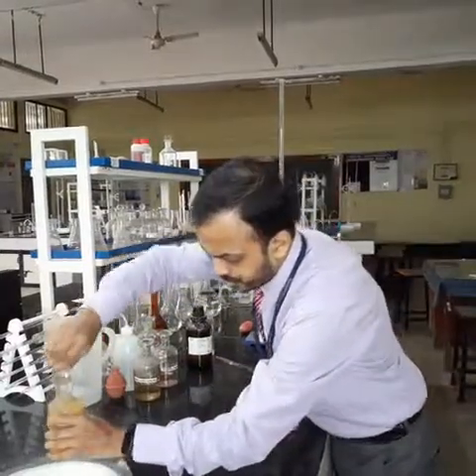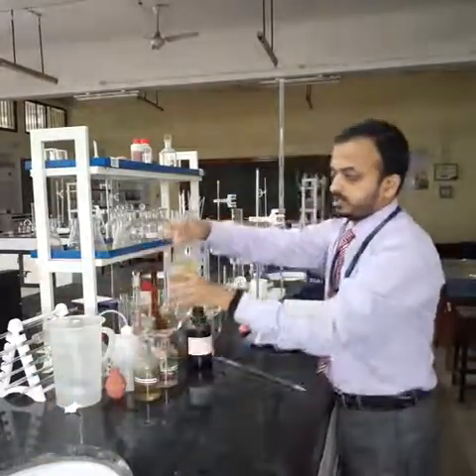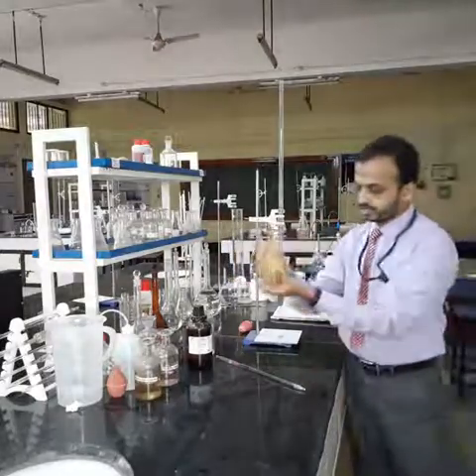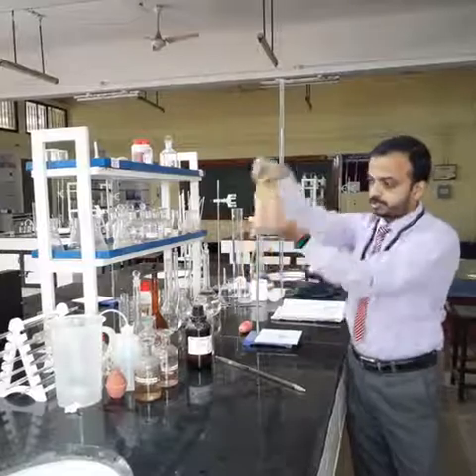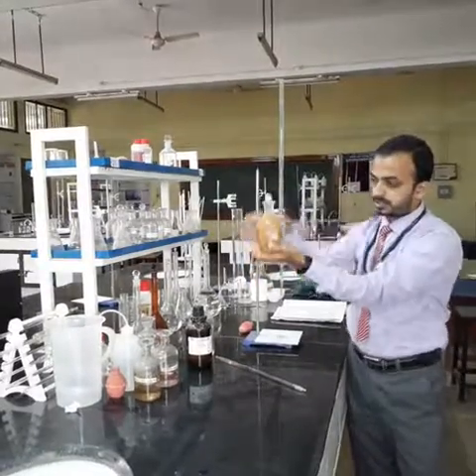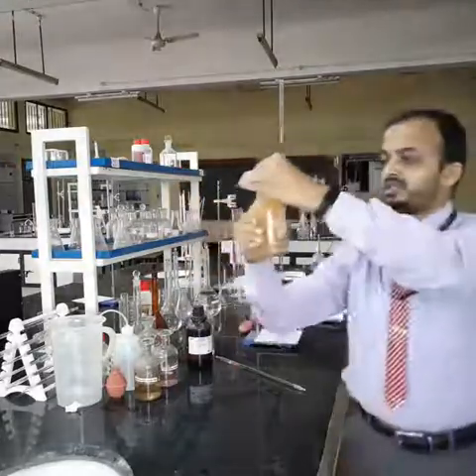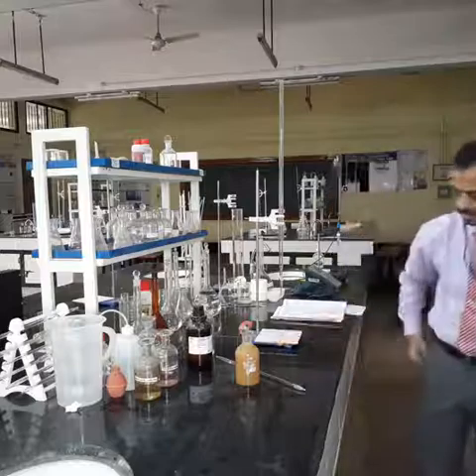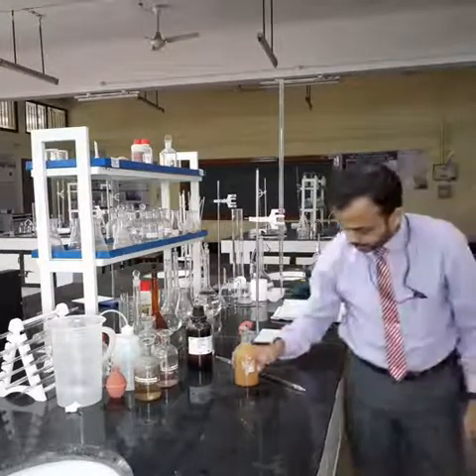Close the stopper thoroughly so that when you shake the bottle, the solution inside the bottle will not fall off. Now shake it thoroughly by inverting the BOD bottle and observe the color carefully. We will let it settle down for some time and then observe the color and the situation we obtain here.